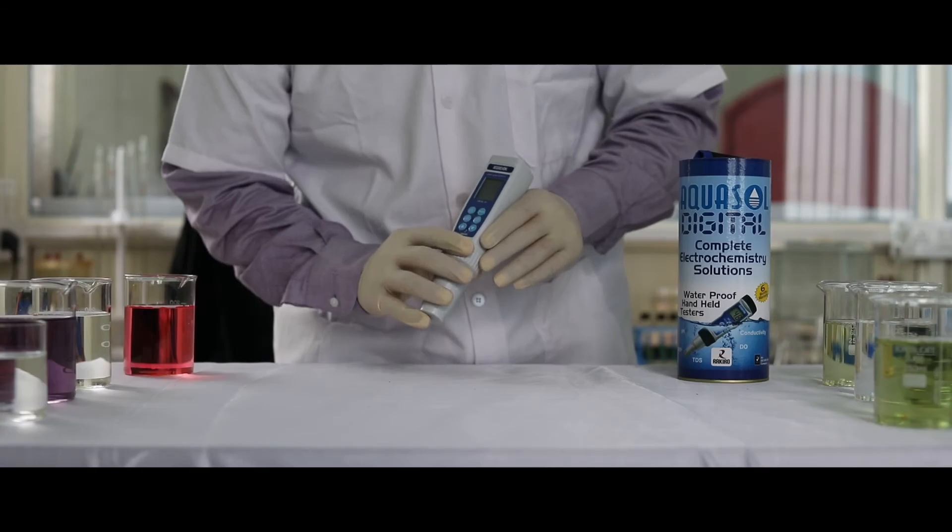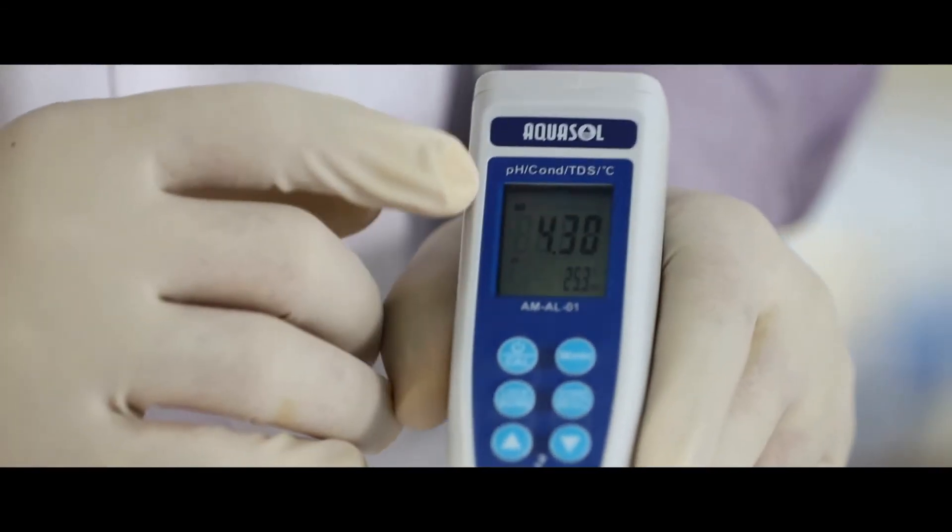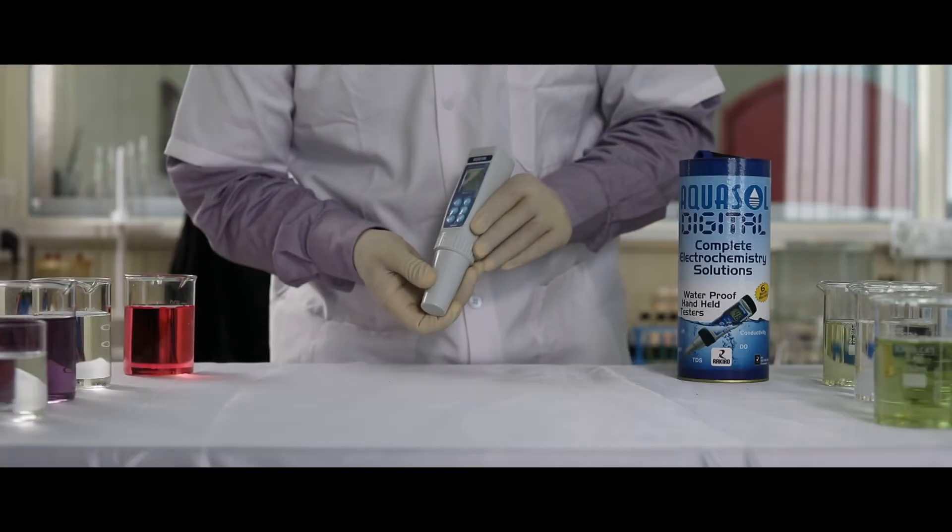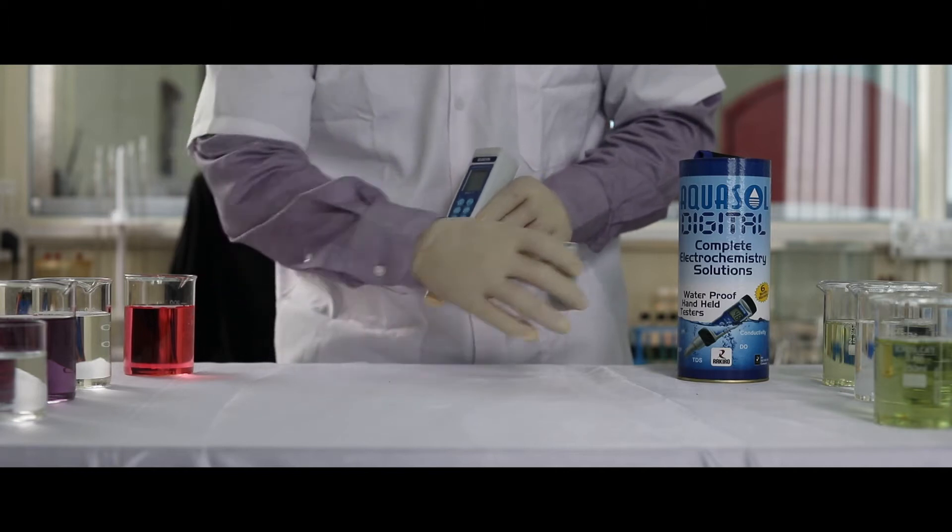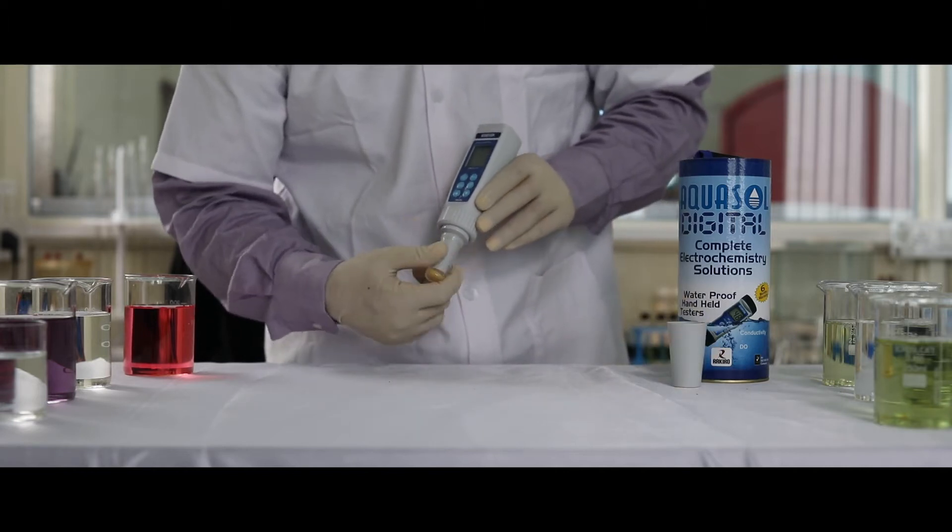AMAL01. Press power to switch on the device. Remove the protection cap and the protection bottle from the electrode.